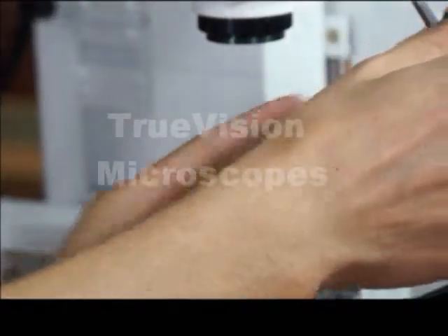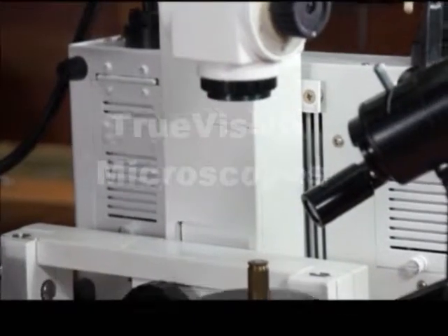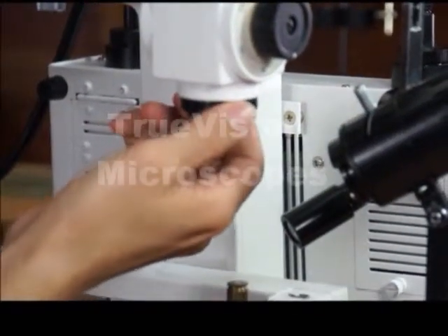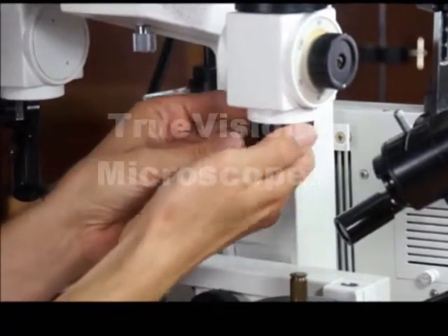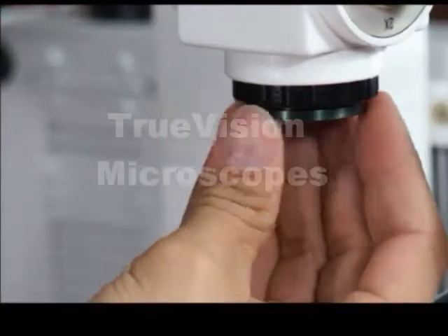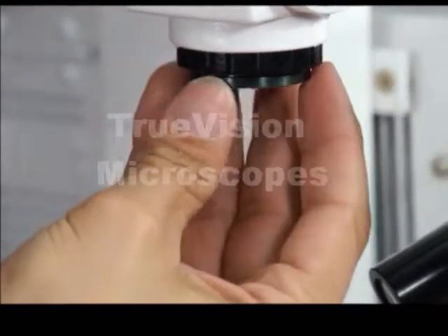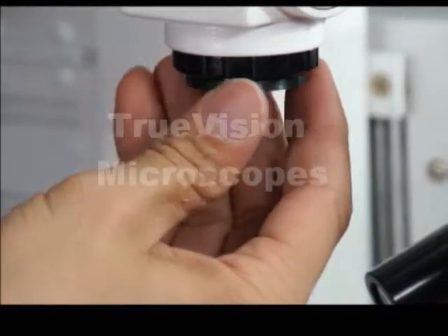I've inserted the polarizing filter into the LED light. Whatever you do to one side, you typically want to do to the opposite side. This is the polarizing filter; this is considered the analyzer. After tightening it down, the bottom ring can be turned — this will neither tighten nor loosen, it simply rotates the polarizing filter. So you can get cross-polarization, and at cross-polarization you have the least amount of light passing through and the greatest amount of contrast for some specimens.